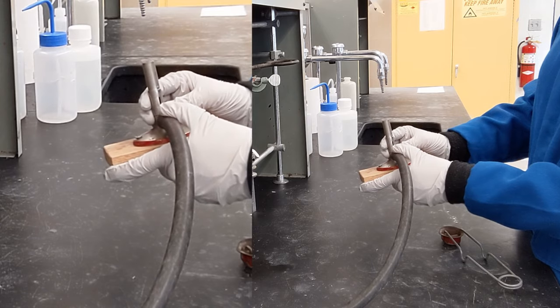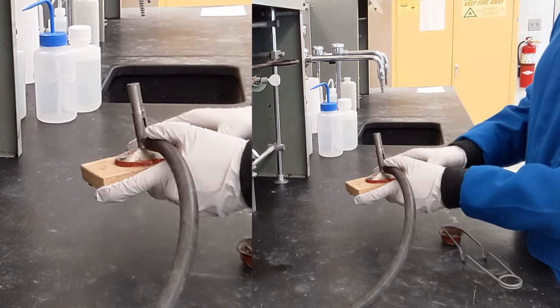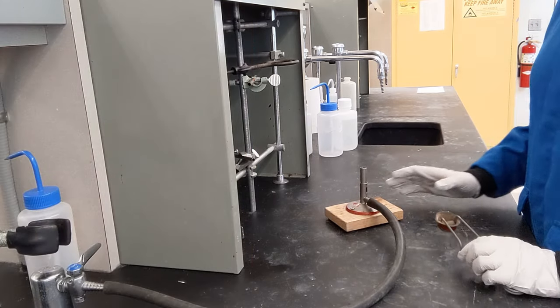This is all the way closed, limited oxygen can get in. This is going to control the size and temperature of the flame.